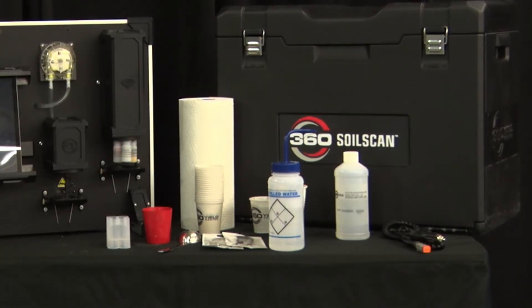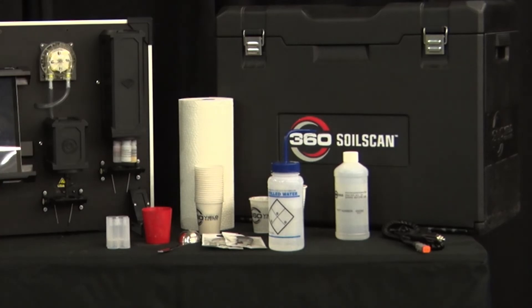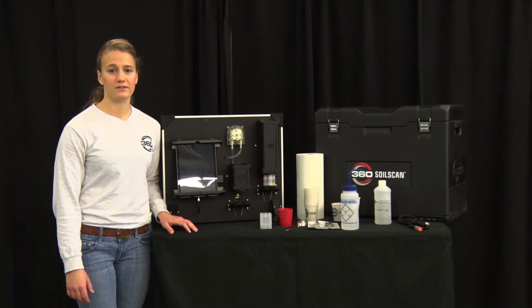Other replaceable components include the motor, a pump, and any of the tools you see on the table, including the power cables. Those will only need to be replaced as needed.